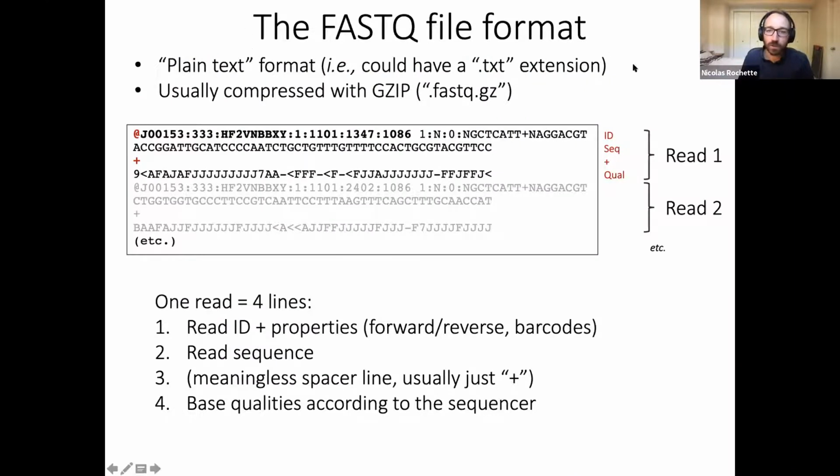So just to come back to these read files. This is what I really meant, and what this means in practice by a sequencing read. This is an Illumina read, and it is just plain text. So it's actually a text file like this. This box here would be the raw output of an Illumina sequencer. That's the end product of a sequencing run, and all the technology behind Illumina is just this one text file. And in this text file, we are going to have groups of four lines.